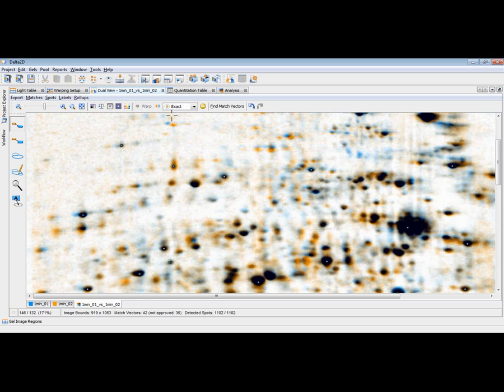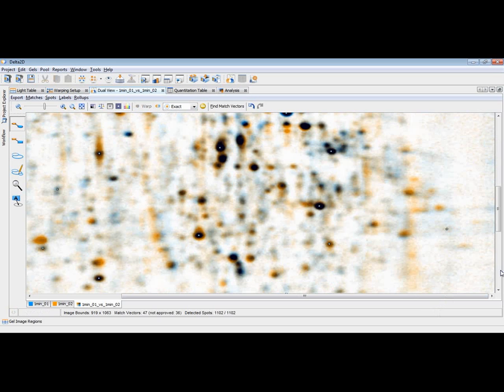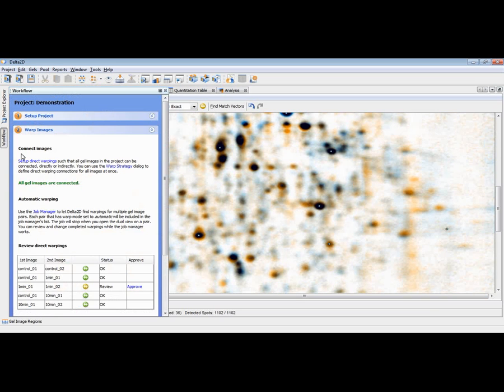There could be some fine-tuning also necessary across the images, and of course we recommend doing this very carefully, to really review the warping, because everything else will later be based upon this image warping. And the better it is, the better your results will be, of course. So review the warpings for all your image pairs carefully, improve them if necessary, and then once you are ready, you can approve all of them, and in the workflow panel you can see that this warping is now done.